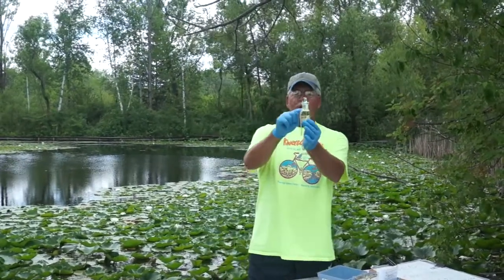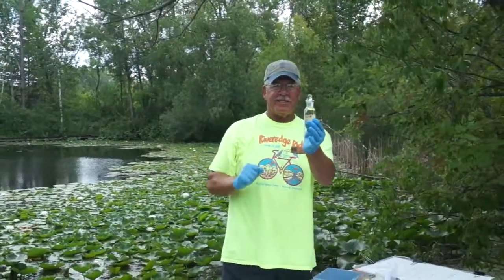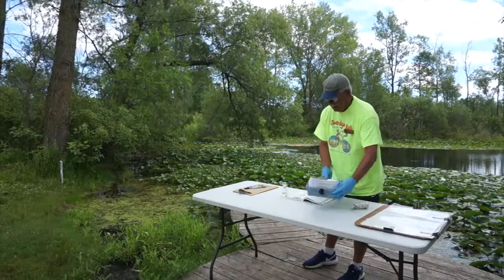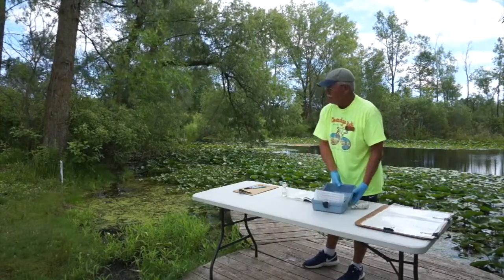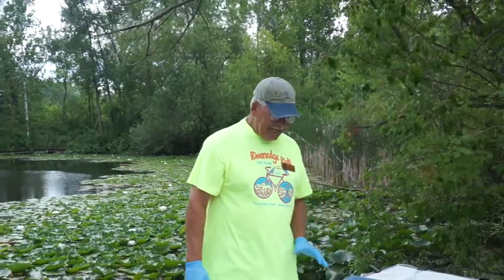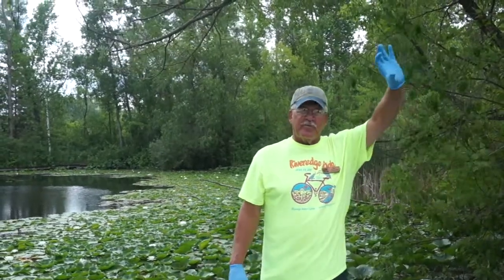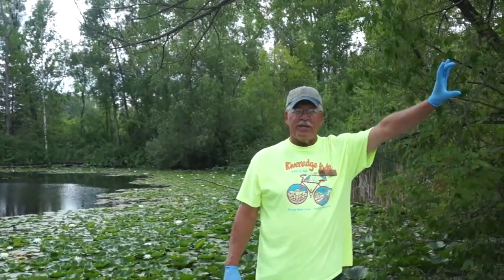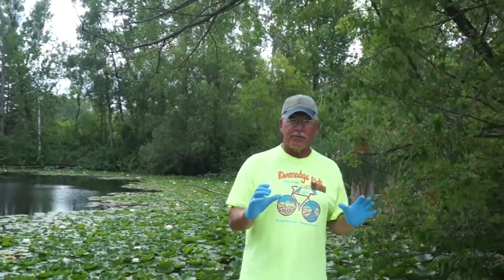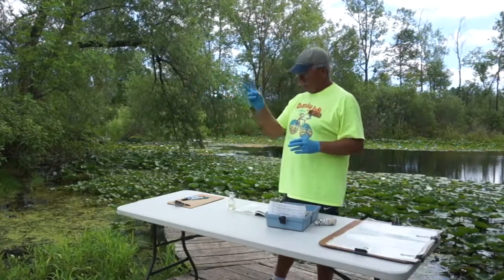After 5 days, we bring this bottle out. If there was any organics in here, the bacteria will have lowered our oxygen content. So now what we do is we take the top off this and we go right ahead and we perform a dissolved oxygen test on this bottle. When we perform that test, let's say for instance we had 12 milligrams per liter 5 days earlier in another bottle we did. And then after waiting 5 days, it was down to 10 milligrams per liter. That means that the bacteria gobbled up 2 milligrams per liter.